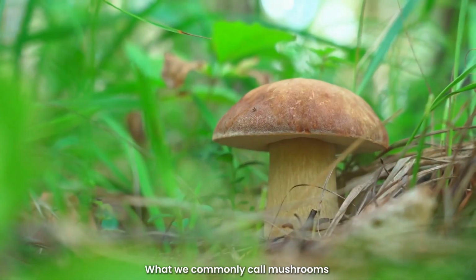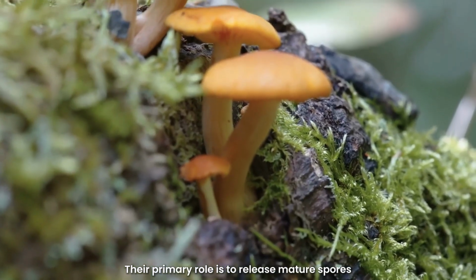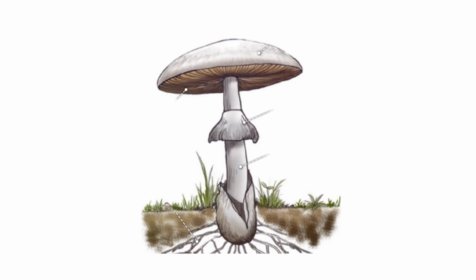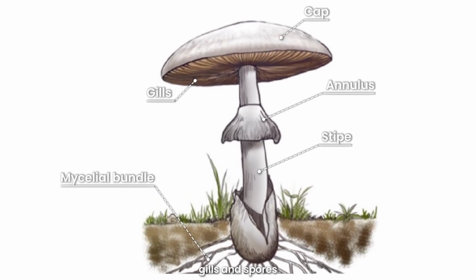What we commonly call mushrooms are actually the fruiting bodies of large fungi. Their primary role is to release mature spores, which function as reproductive organs. Typical structures of the fruiting body include the cap, stalk, gills, and spores.